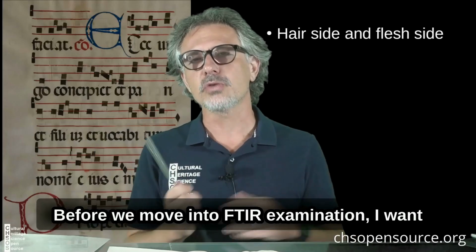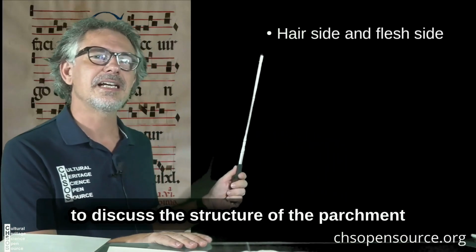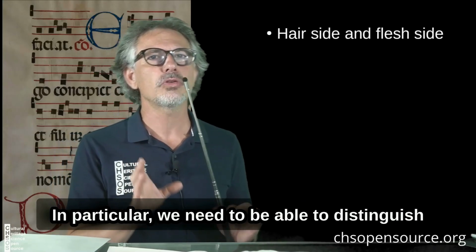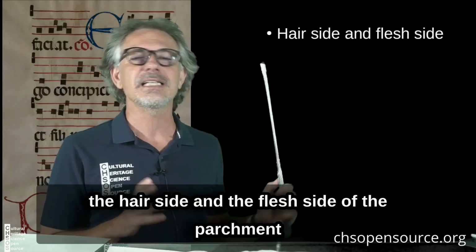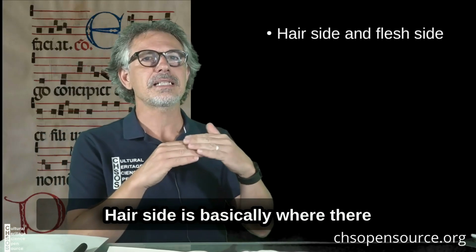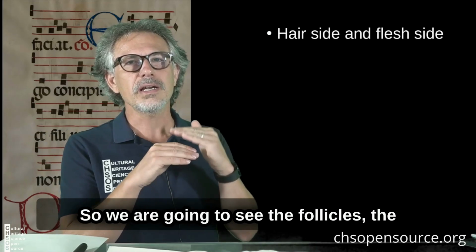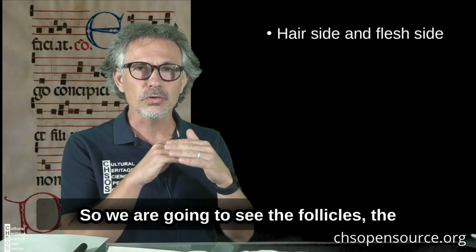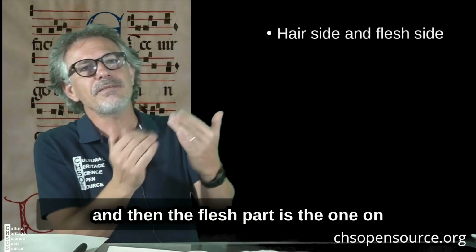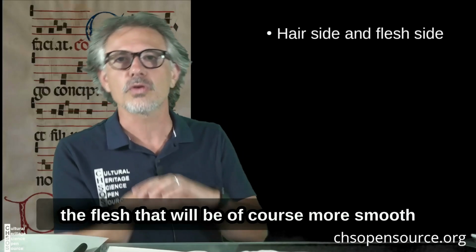Before we move into FTIR examination, I want to discuss the structure of the parchment. In particular, we need to be able to distinguish the hair side and the flesh side of the parchment. Hair side is basically where there is hair on the skin. So we are going to see the follicles, the structure of the upper part of the skin, and then the flesh side is the one on the flesh that will be, of course, more smooth.